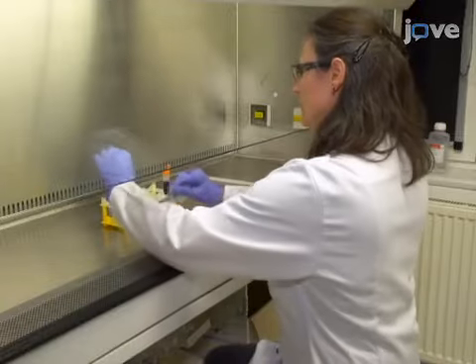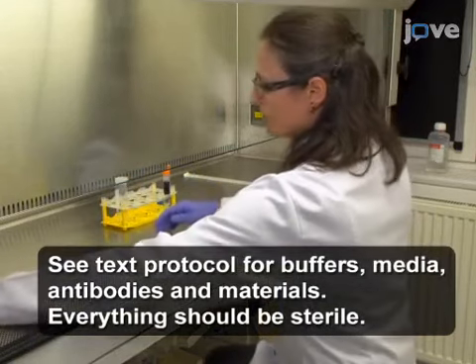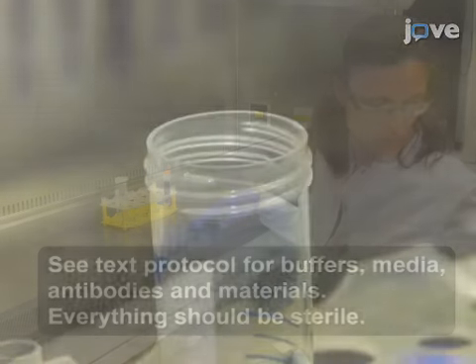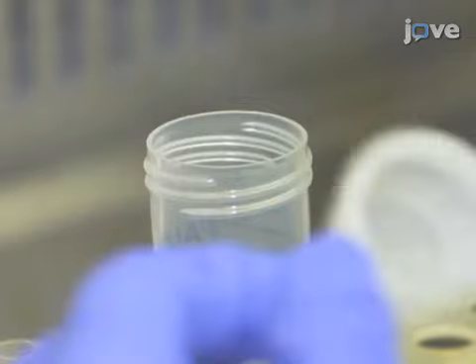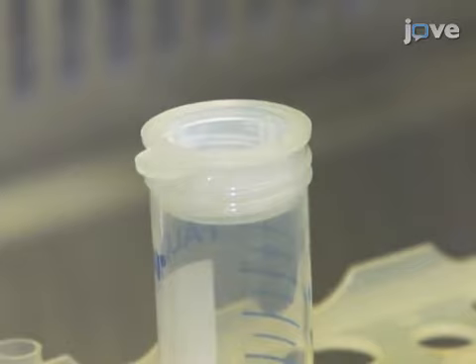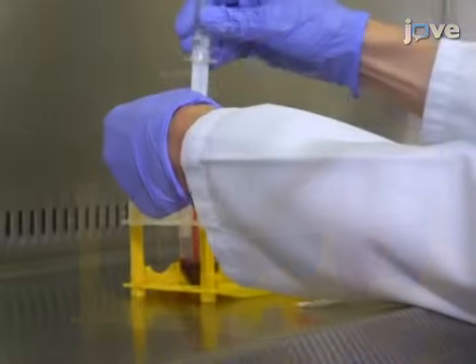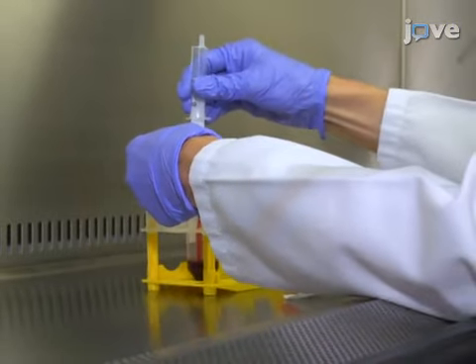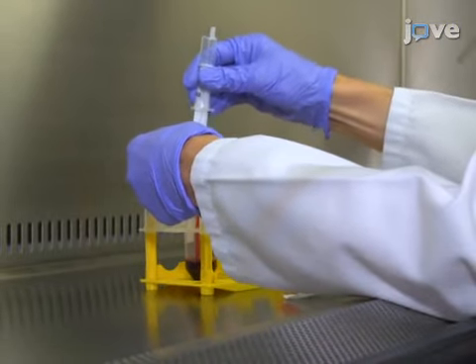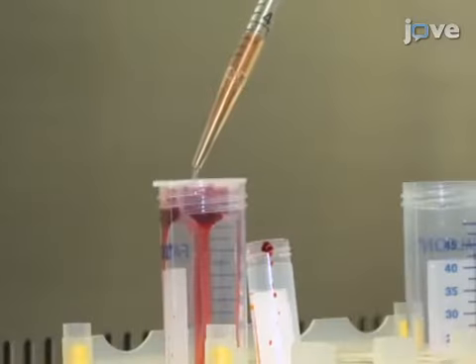To begin, generate a single-cell suspension of the bone marrow sample for FACS staining. To do this, place a cell strainer containing the bone marrow aspirate on top of a centrifuge tube. Use the syringe plunger to force pieces of tissue through the mesh. To collect all material, rinse with a few milliliters of suspension buffer.